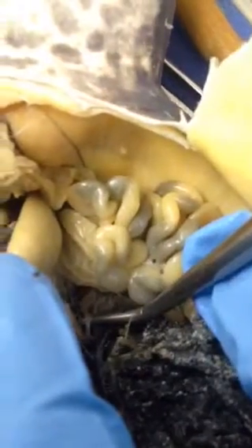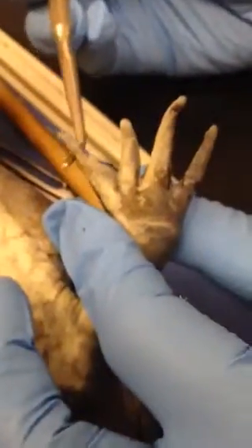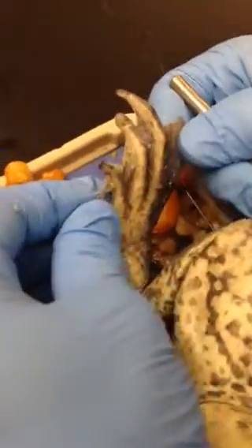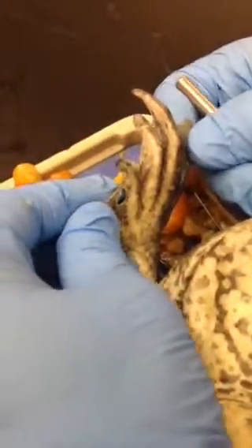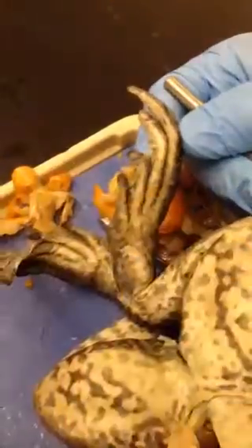Nictitating membrane. These are fingers — they are not webbed. There are four on each hand, so eight total. These are the toes; there are five on each foot and they are webbed.